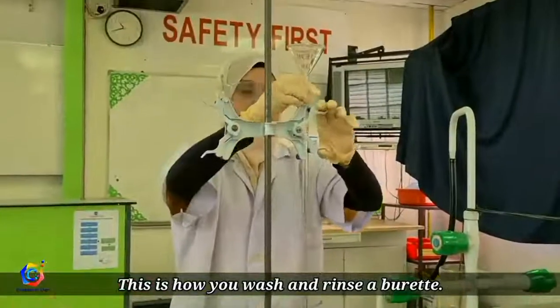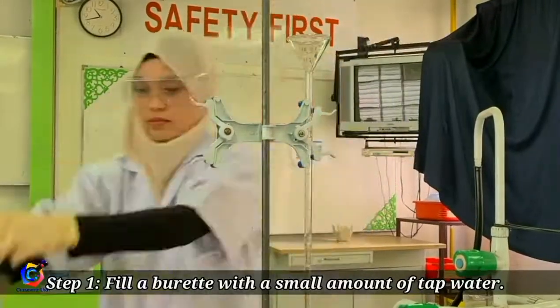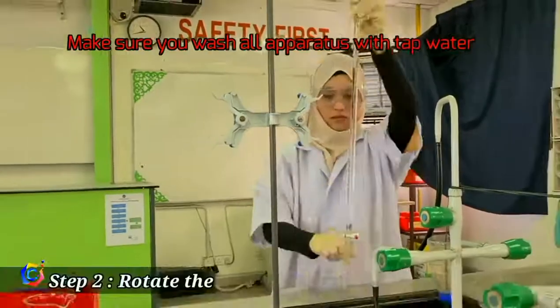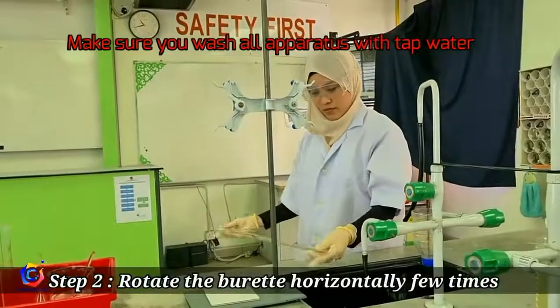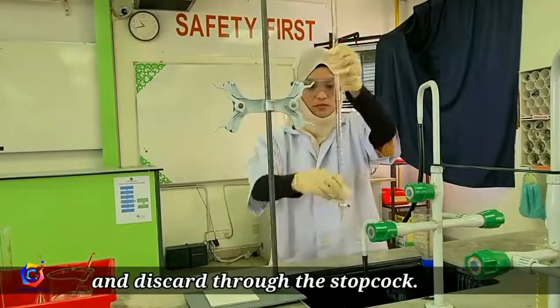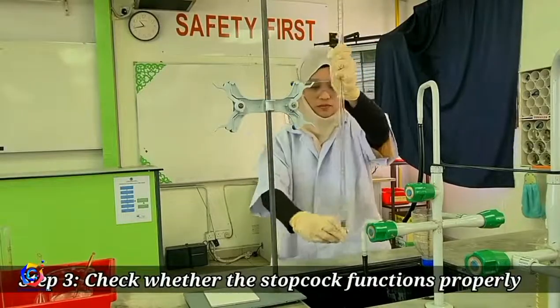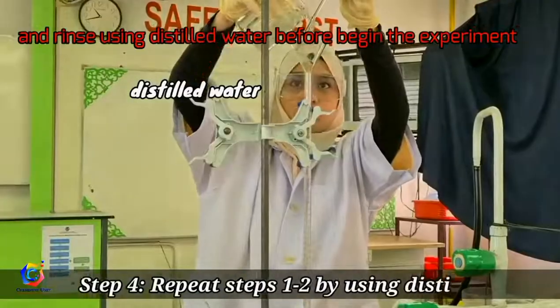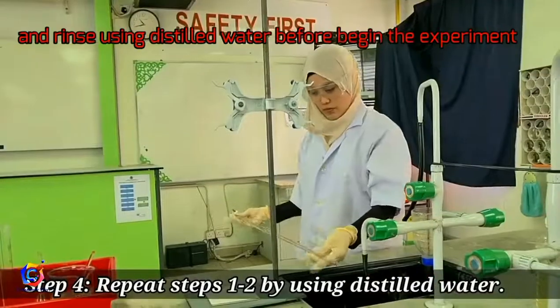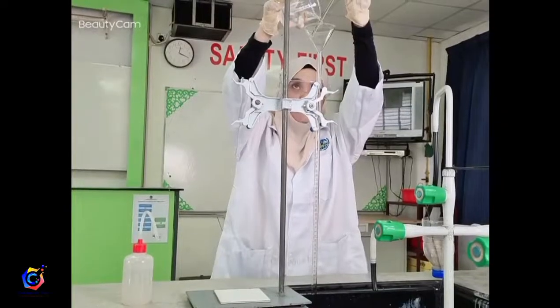Now let's start experiment 3. Let's recap how to use the burette. Fill the burette with a small amount of tap water, rotate the burette horizontally a few times and discard through the stopcock. Check whether the stopcock functions properly and repeat the steps by using distilled water.